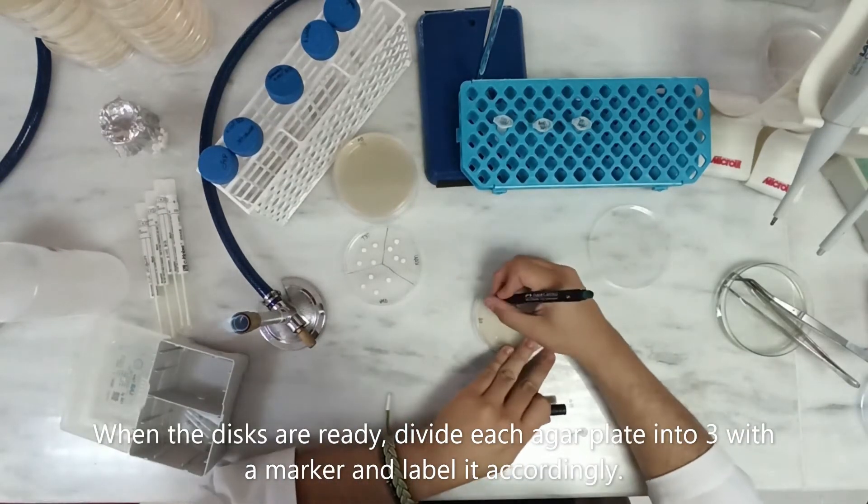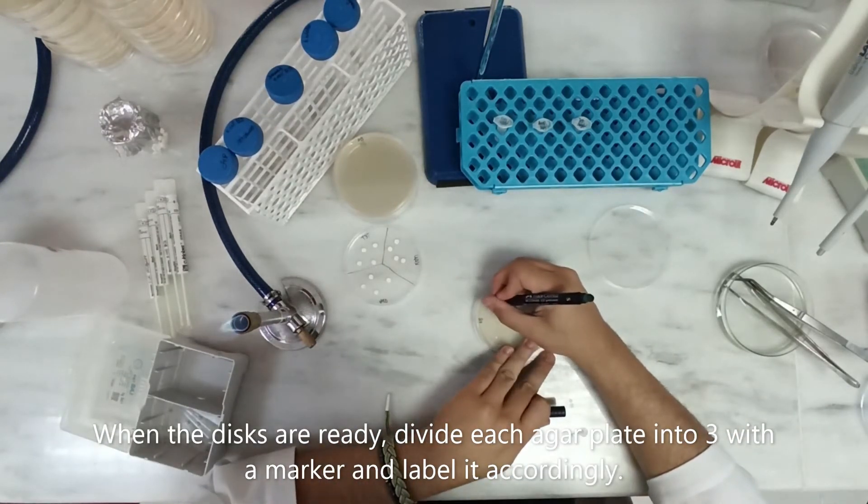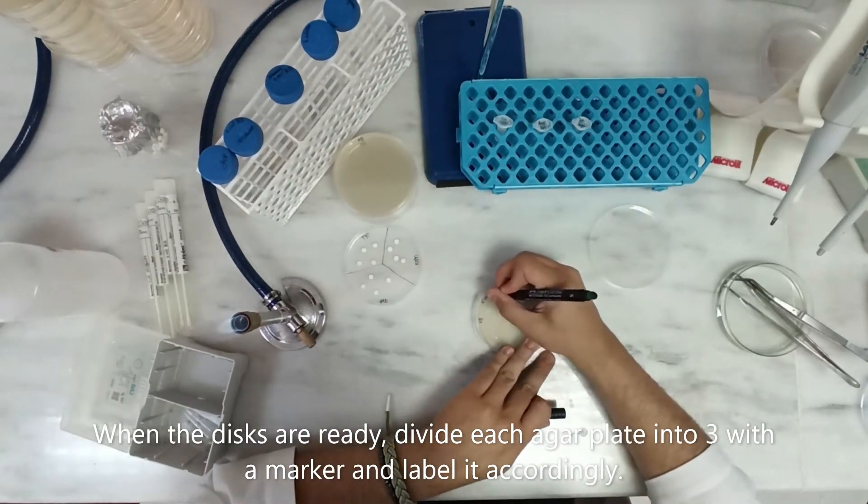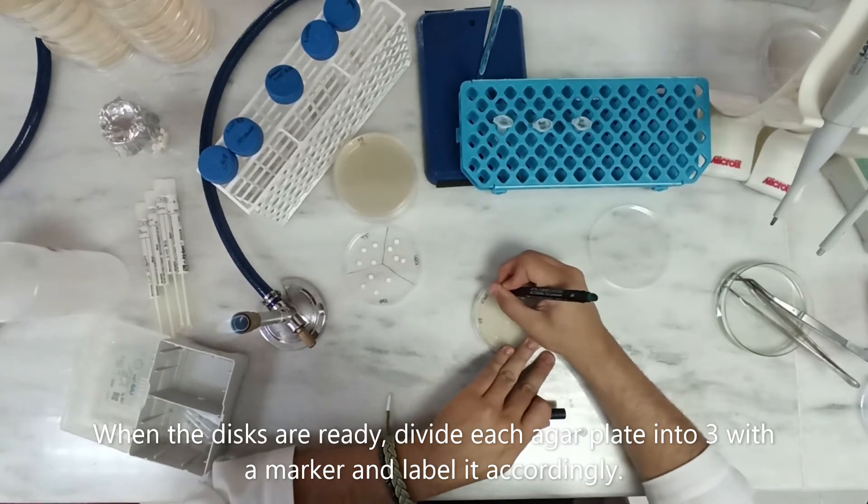When the disks are ready, divide each agar plate into three with a marker and label it accordingly.